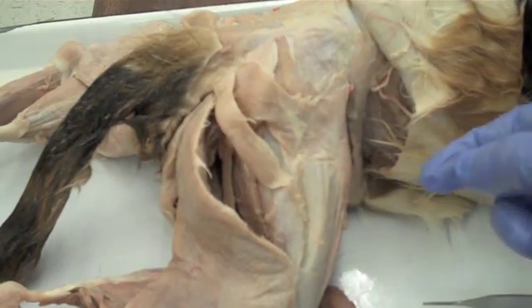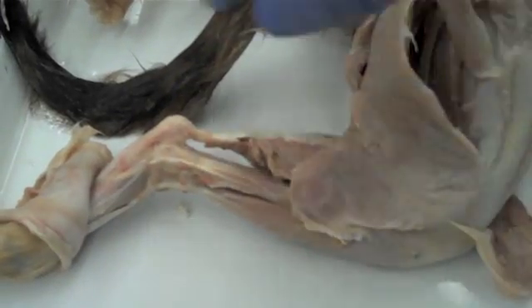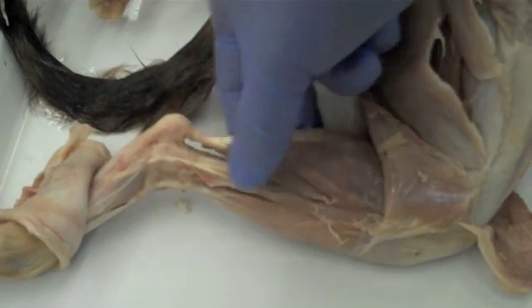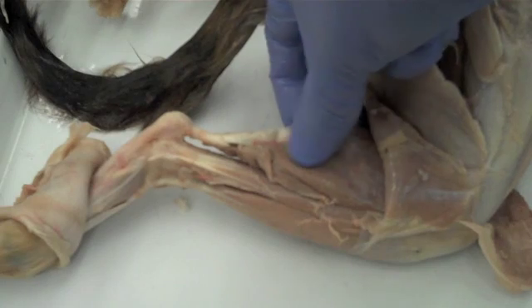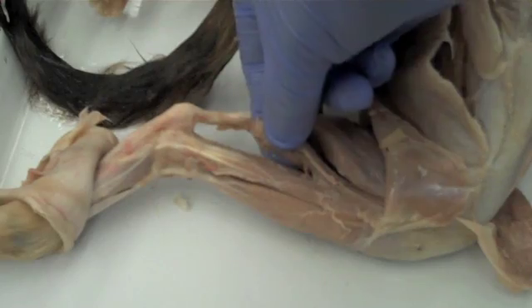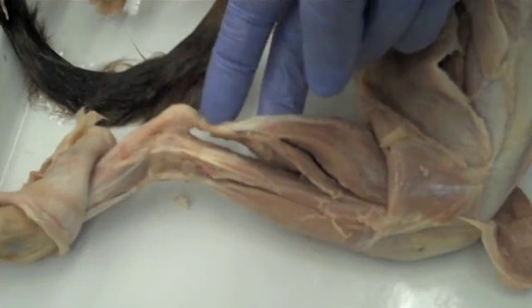Also visible down here if we pan over are the muscles of the lateral leg. Starting at the back we've got the calf, which is composed of two muscles: the gastrocnemius found right here, and underneath it the soleus found right here. Both of these merge into the Achilles tendon found right here.